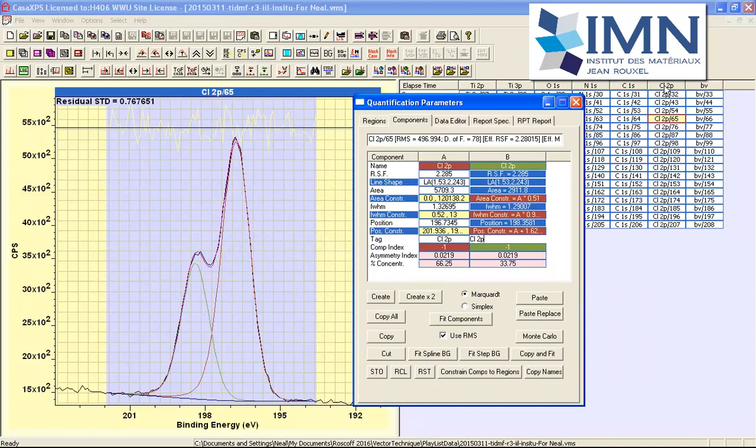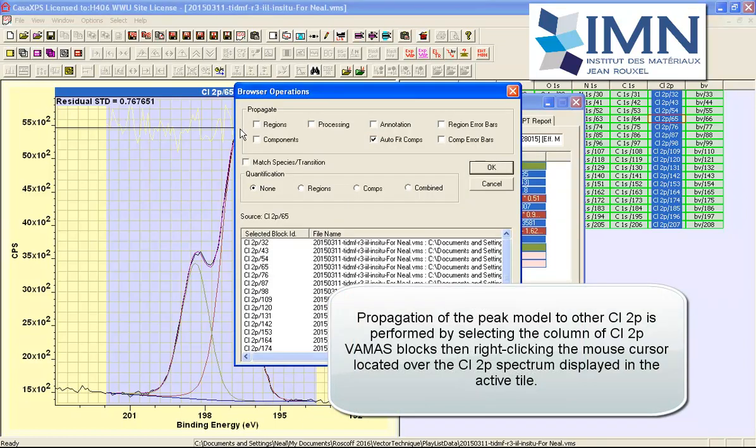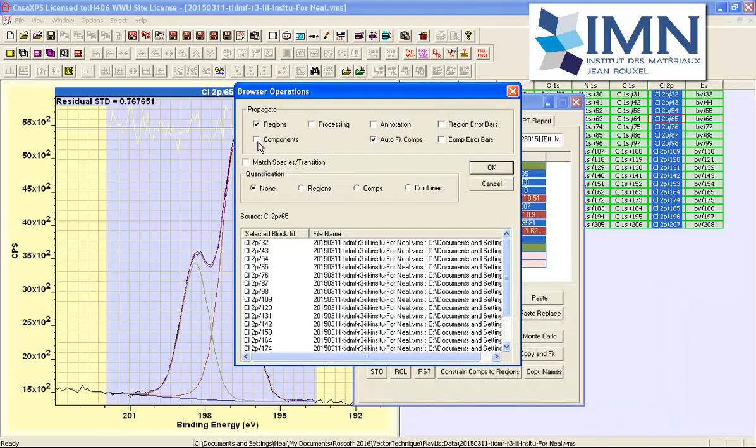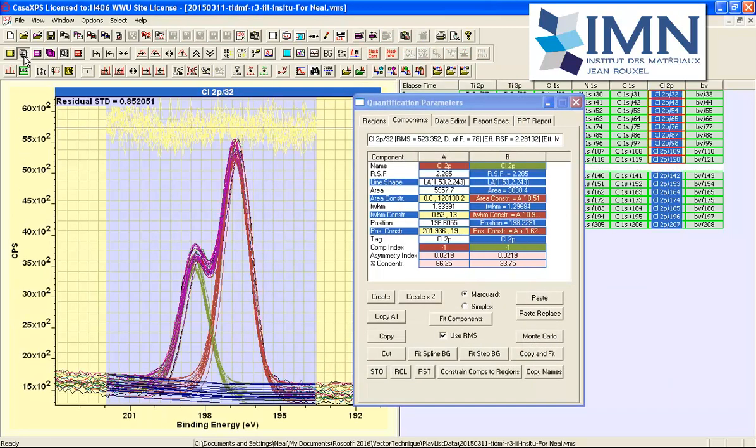And then if I select the other chlorine 2P data and I say propagate, and I propagate regions, components, and I auto fit, then we should find that we have a fit on each one of these spectra. So I've overlaid the chlorine 2P data, and you can see that the peak model is indicating we do have shifts, and these have all been fitted using this constrained peak model.